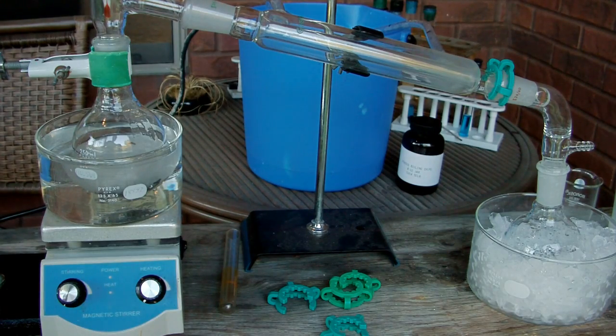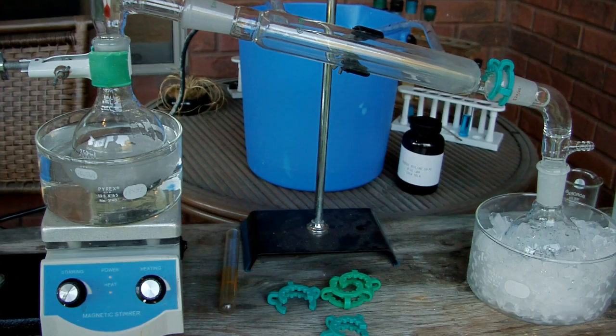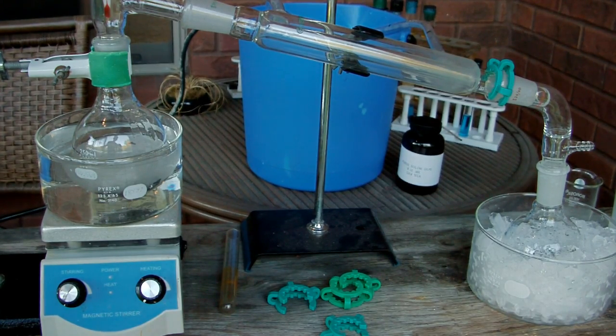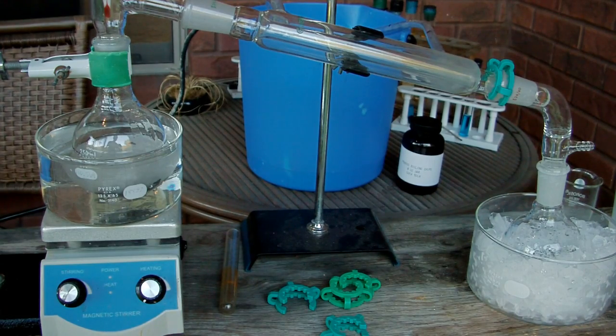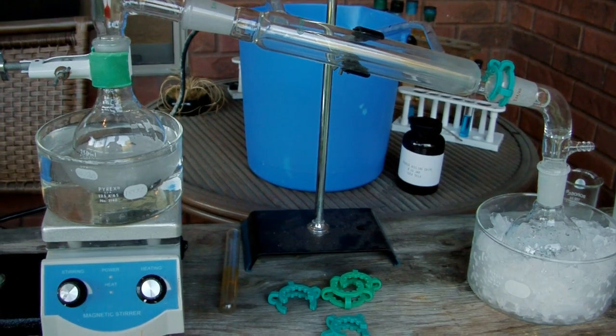Before I'd already done a distillation to improve the purity of one substance, that was acetone, just more or less pure acetone. This is going to address if you have different solvents mixed together and you only want one of them or you want to split them up into their component parts.